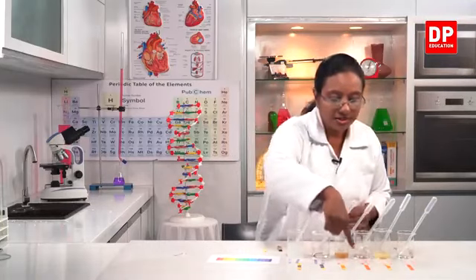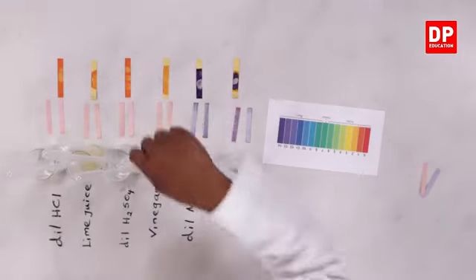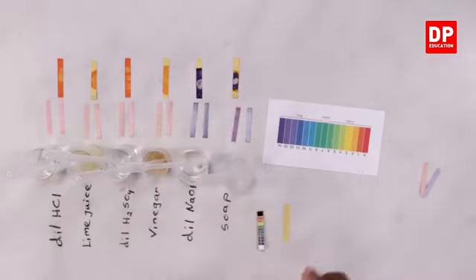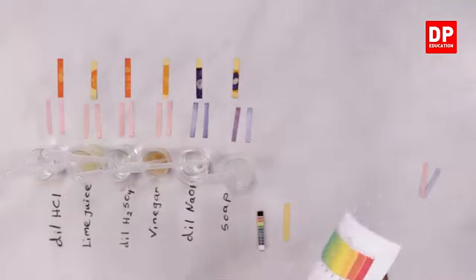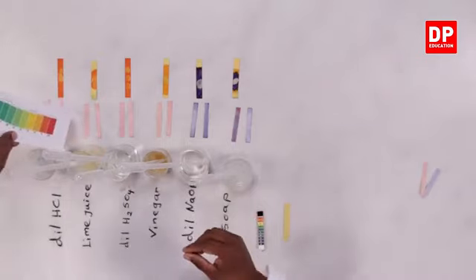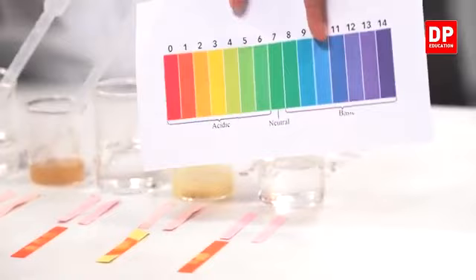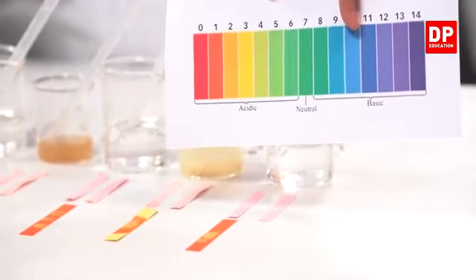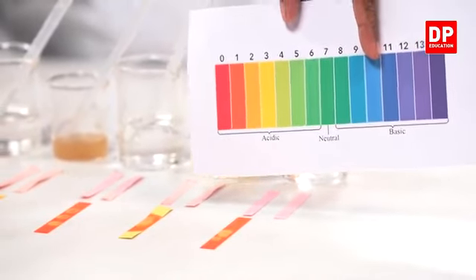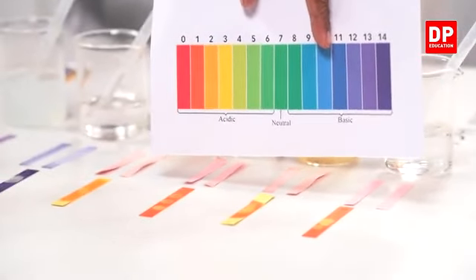Now can you all see a difference here, students? Now this dilute hydrochloric acid and dilute sulfuric acid, the color is more darker. So if I bring the paper here and compare, can you see the colors? It's almost between 0 and 1. We can take the pH range as 1. Can you see here the pH scale? We can take it as 1.